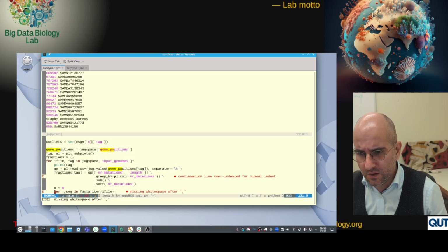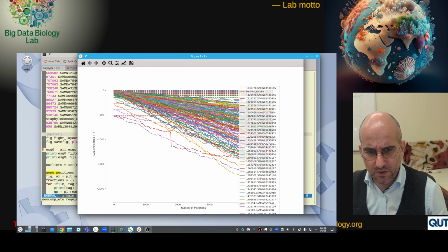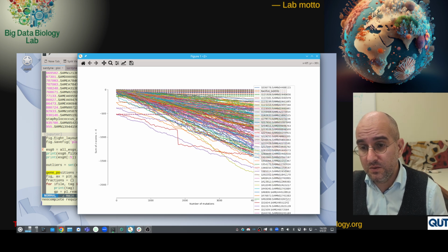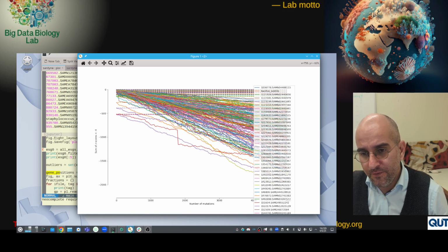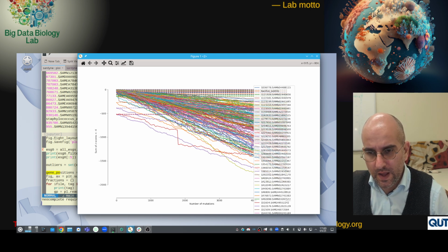So let me start sharing my screen. Today I actually won't go through the code. Let me just show you a plot that we had seen before. This is the plot we've been looking at for the last several weeks. On the x-axis is the number of mutations, everything done by simulation. We start at 0 with a genome from ProGenomes, so supposedly a very good genome, and then we add mutations. The full lines are the sum of z-scores below -4, our excess of small genes, and it goes down, whereas the dashed lines just represent the values at the 0 point.